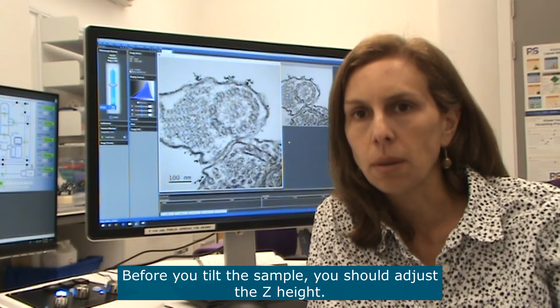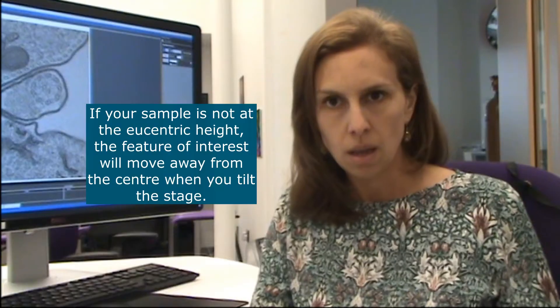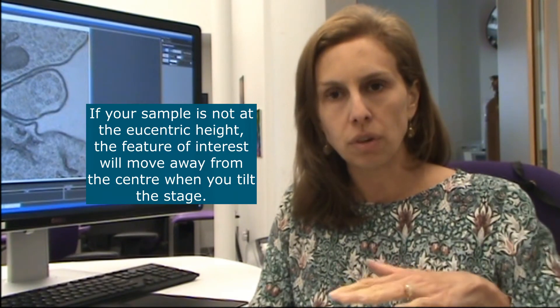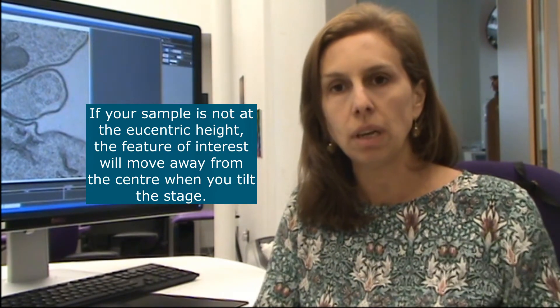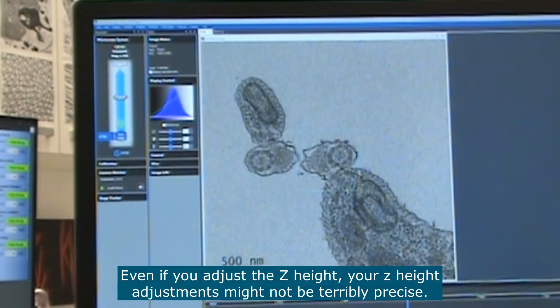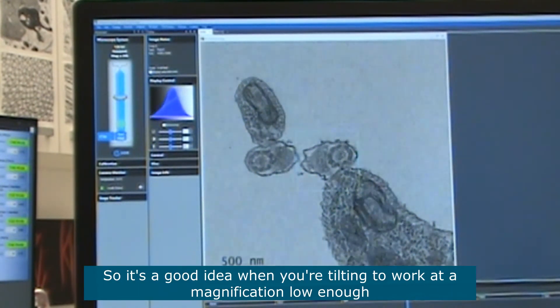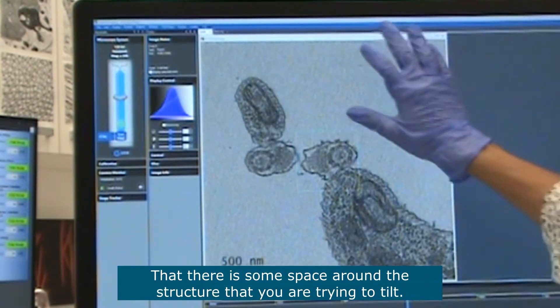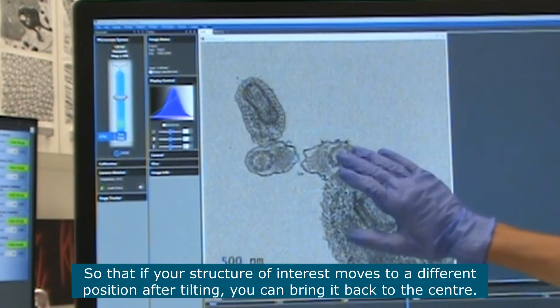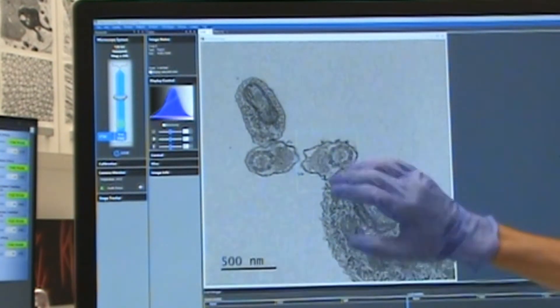Before you tilt the sample, you should adjust the z-height to make sure your sample is at the eucentric height. If your sample is not at the eucentric height, your feature of interest will move away from the center of the screen as you tilt it. Even if you adjust the z-height, your adjustments might not be terribly precise, so it's a good idea when tilting to work at a magnification low enough that you can see a good area around the structure, so that if it moves after tilting, you can bring it back to the center.